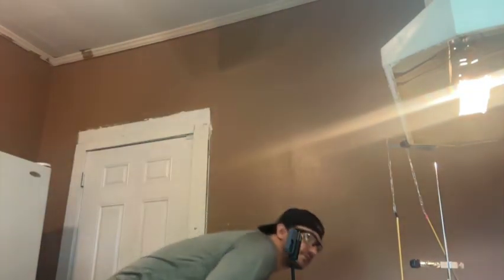So our water is now at approximately 51 degrees Celsius. So we're gonna get started.